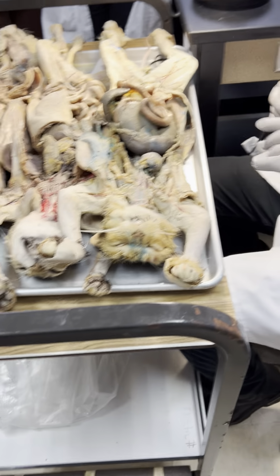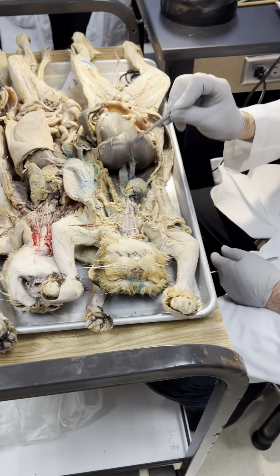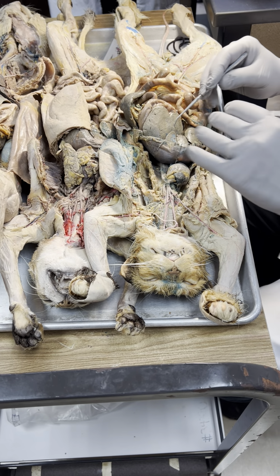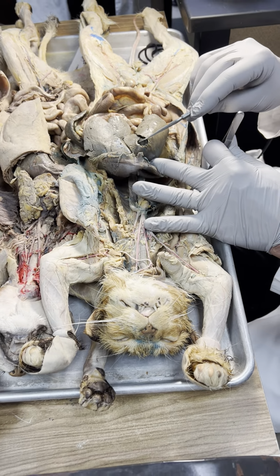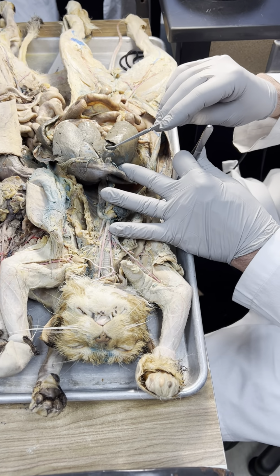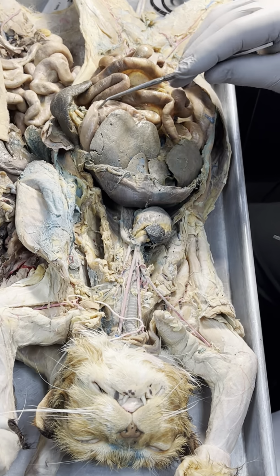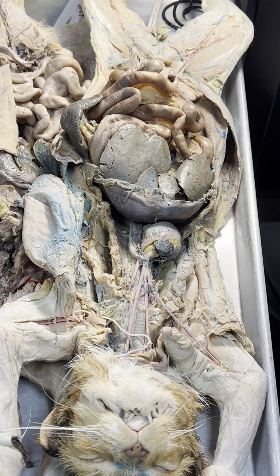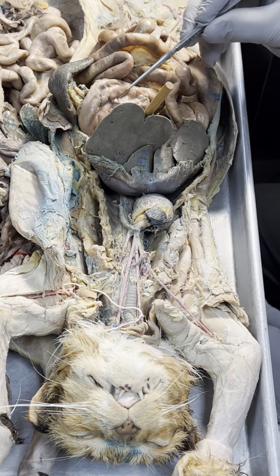So we're doing organs too, right? So let's do organs. Diaphragm. Liver. You don't need to get the lobes. Liver. That little deflated balloon in there. Gallbladder. Underneath the liver here. Stomach. That one's kind of hidden, so I'd probably do something like this. Stomach.